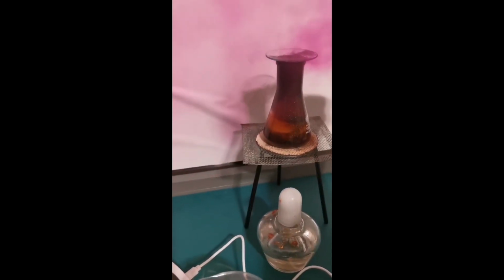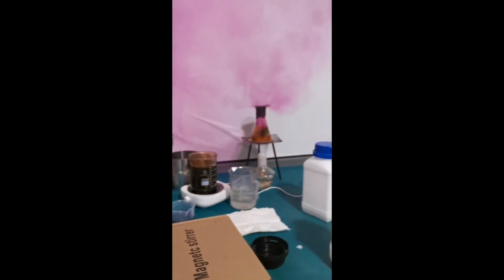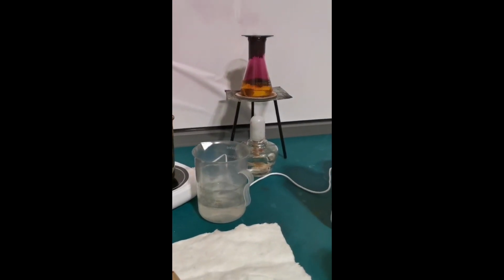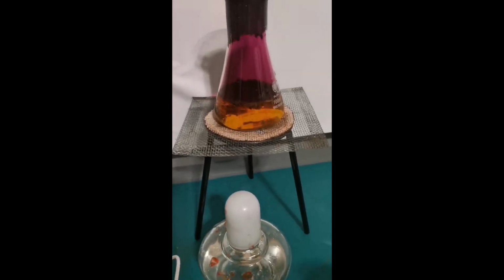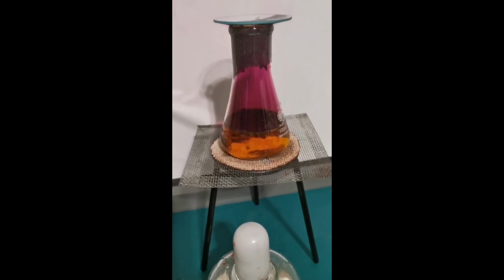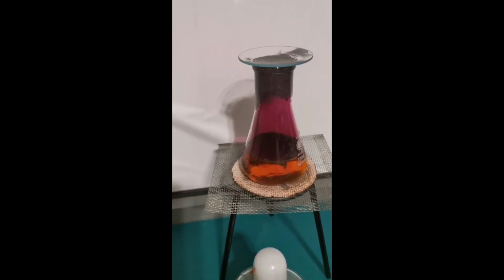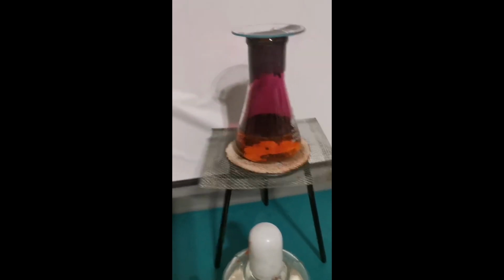I went away to grab some equipment, and when I came back, I saw this horrific scene. The mixture boiled violently, and lots of iodine vapors sprayed out of the flask. I retreated backwards, and after a few seconds, the mixture seemed to stabilize a little. No more vapors were forming, and the solution stopped boiling. I let out a deep breath. The whole room was now full of iodine vapor, so I left the room for 30 minutes.